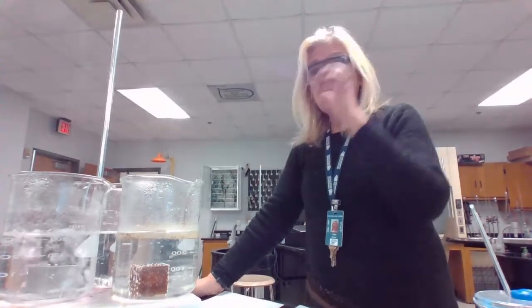And so we are letting these heat. I'm going to take a final temperature of each one, which will represent the starting temperature of the metal, and we are going to need to take a starting temperature of the water. So far, our data table will need the masses of each metal, the identities of each metal, the starting temperature of each metal, the starting temperature of the water, and then an ending temperature of the water, which will be the same as the ending temperature for each metal, because we're going to put it all together and they will equilibrate. In other words, they will come to the same temperature, thermal equilibrium.